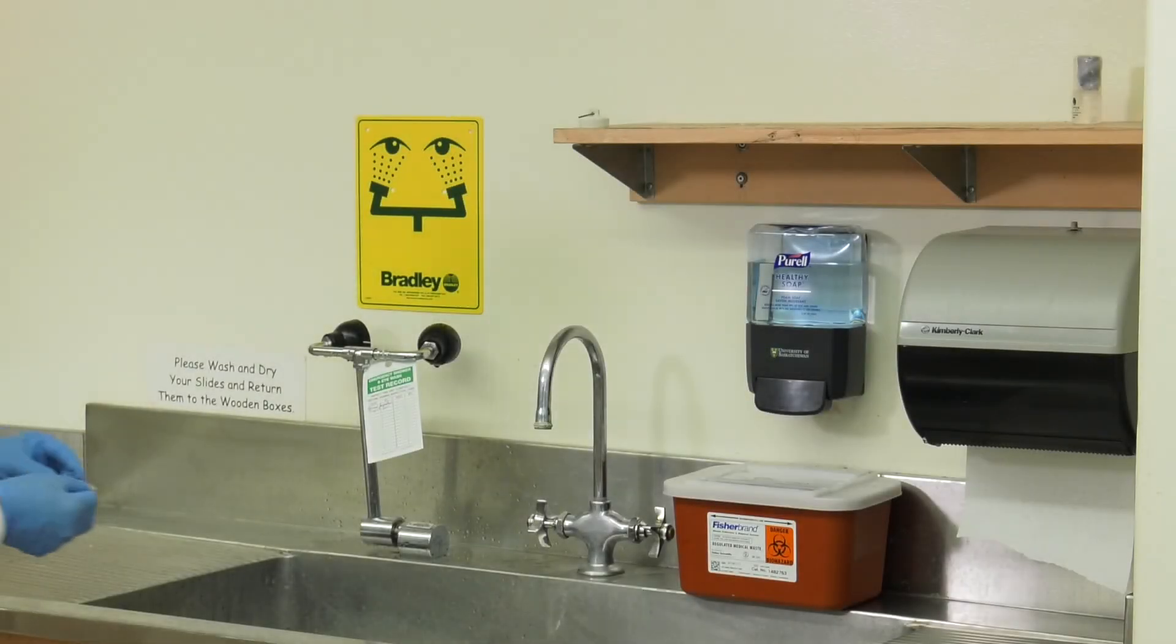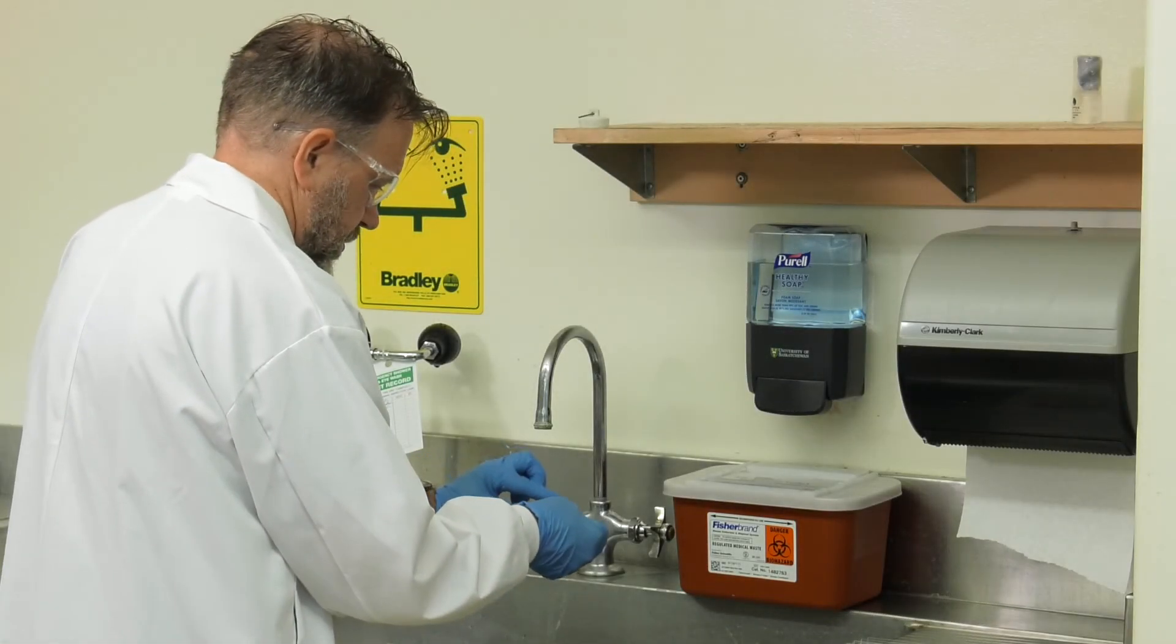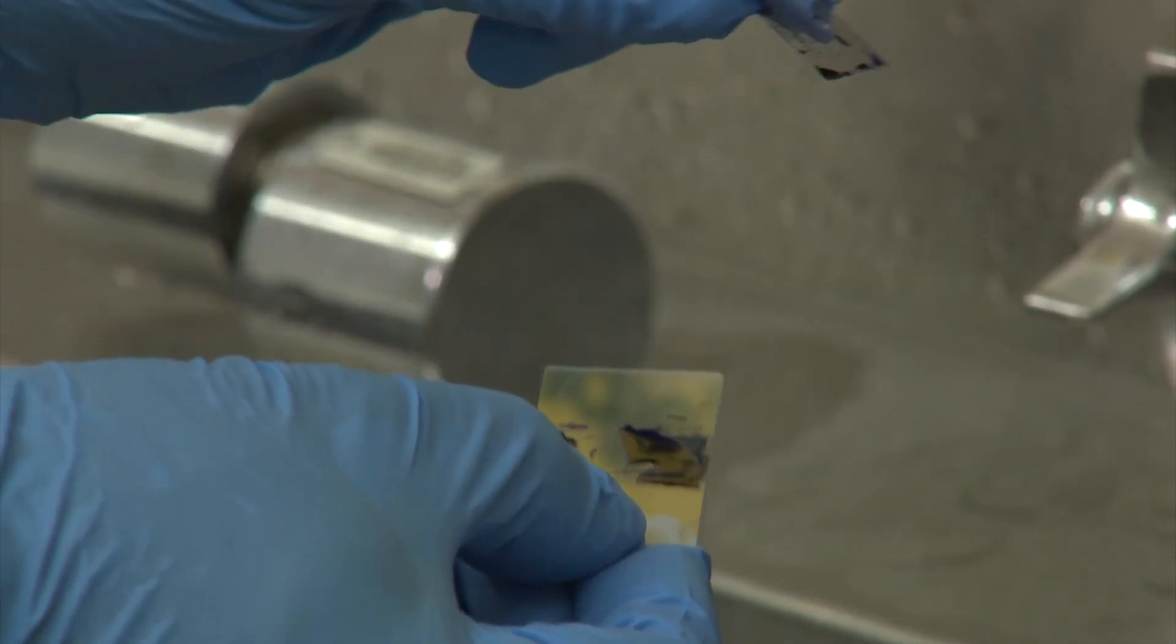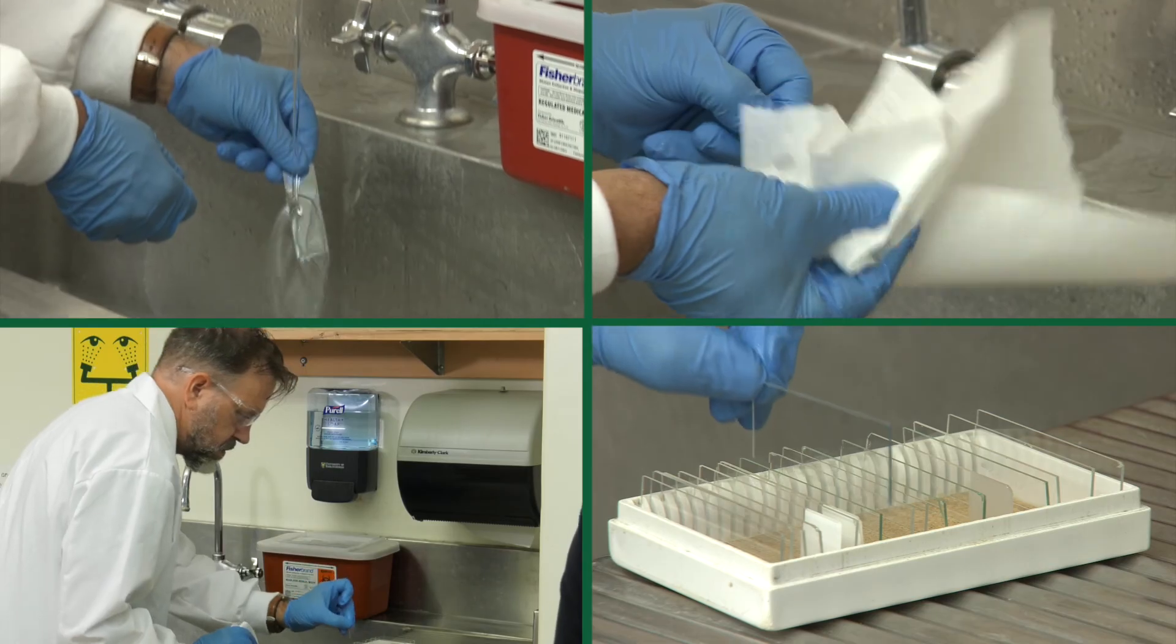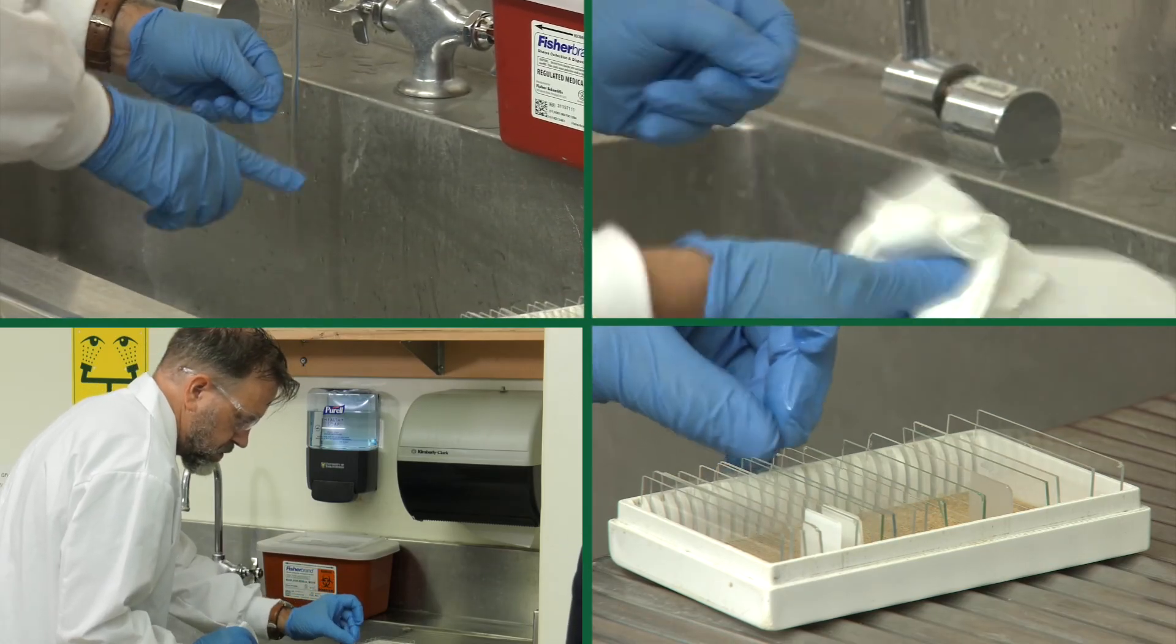Once finished with your preparation, take your slide to the sink. Carefully remove the cover slip and discard in the provided sharps disposal. Rinse and dry your slide and return it to the slide box.